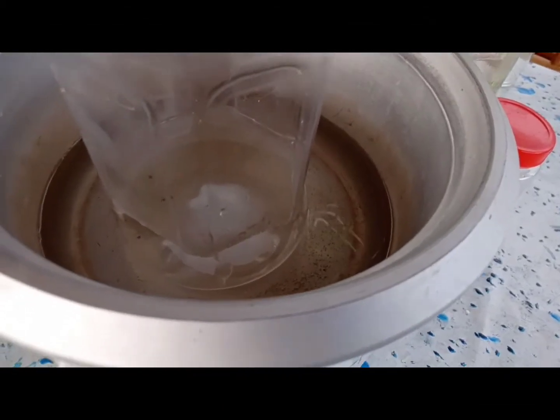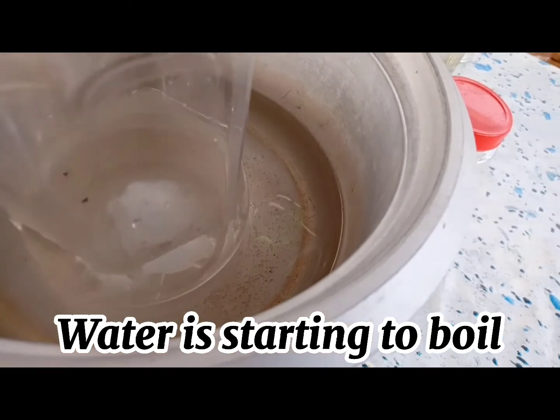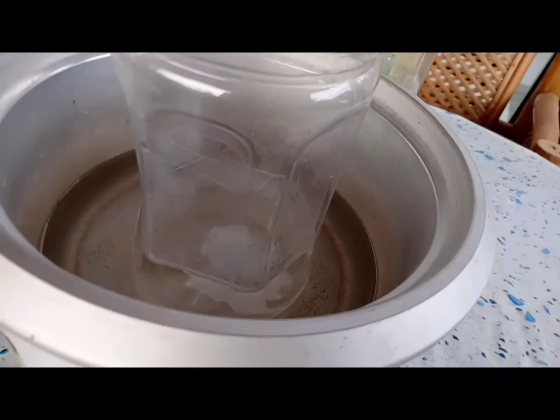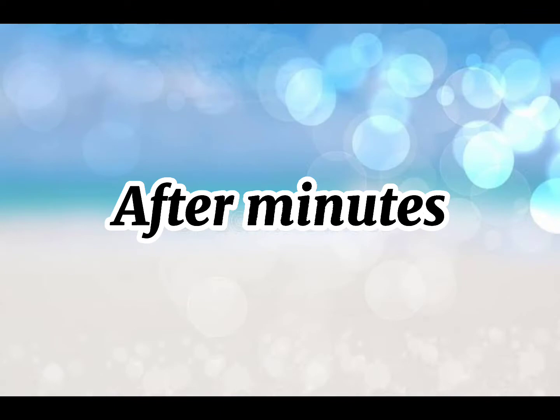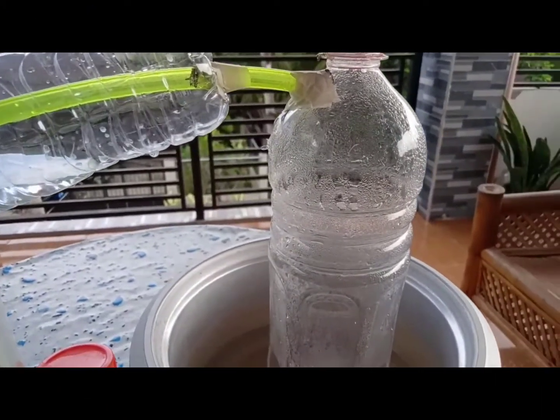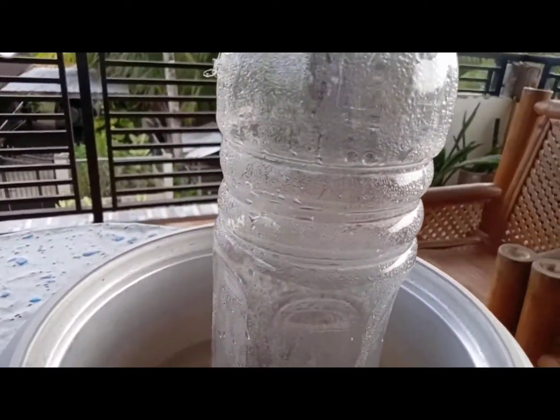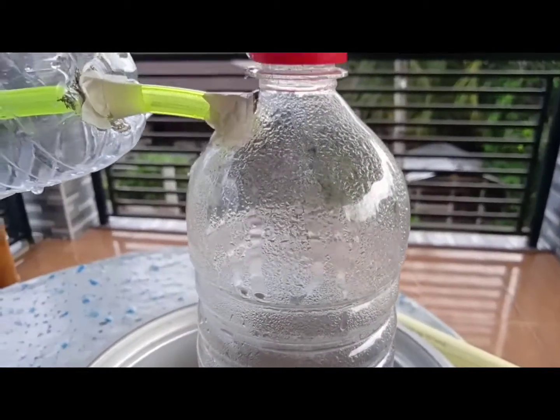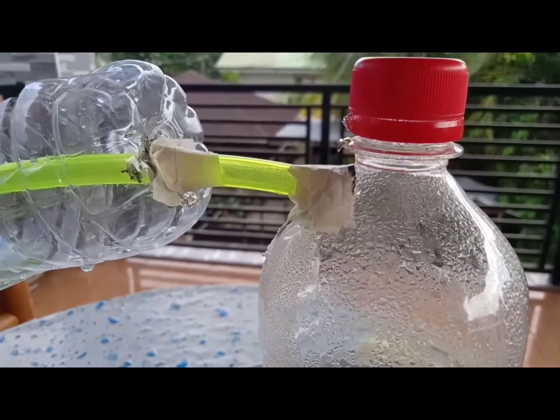As we can see, the water is starting to boil. We can see bubbles. After a few minutes, we can observe vapors in the container, as you can see, and also in the tube or the pipe.